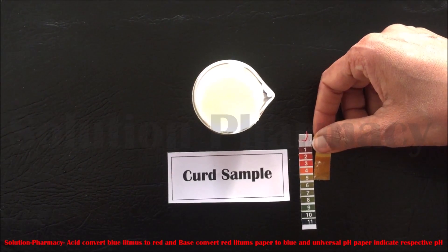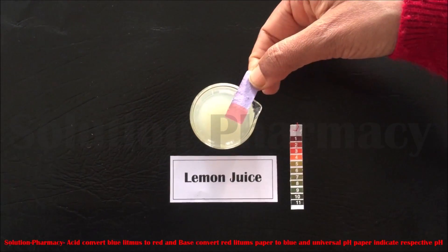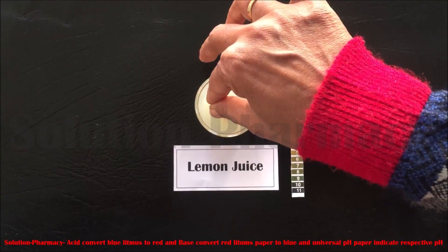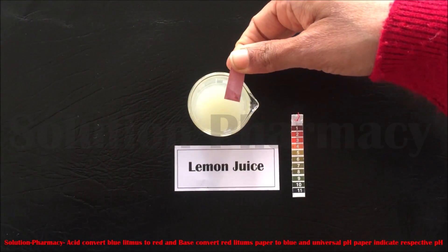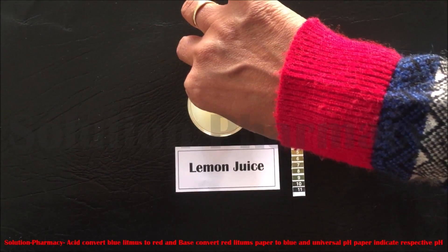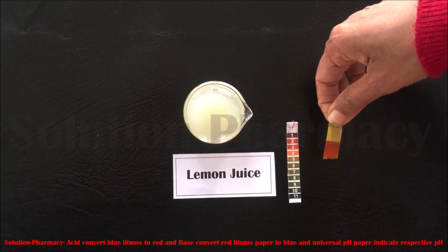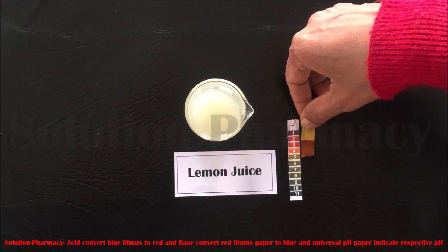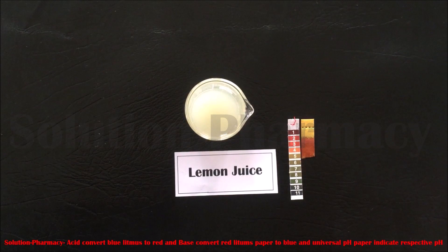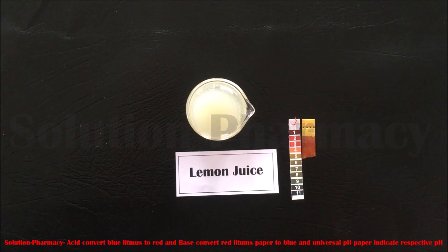The next sample is lemon juice. Dip the blue litmus into lemon juice — blue litmus changes to red, which means lemon juice is acidic in nature. Next, dip the red litmus paper into lemon juice; there is no change in the color of the red litmus paper. Then dip the universal pH paper to determine the pH of lemon juice. After a few seconds, match the color change with the pH paper chart. The color matches the value 3, so the pH of lemon juice is about 3.